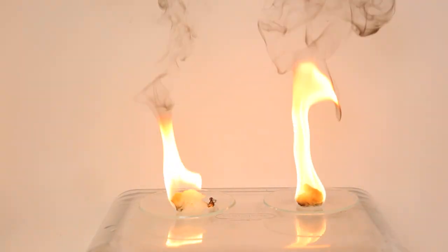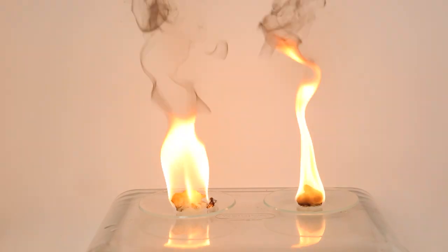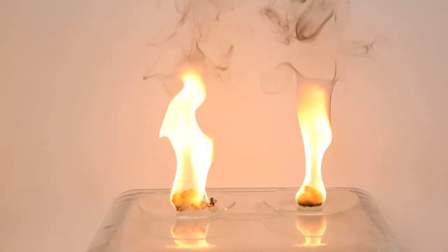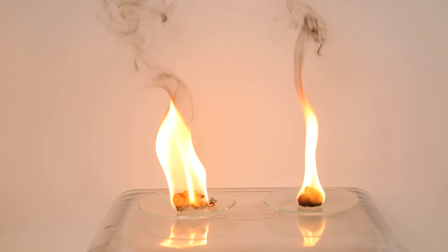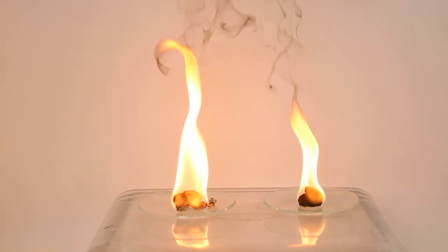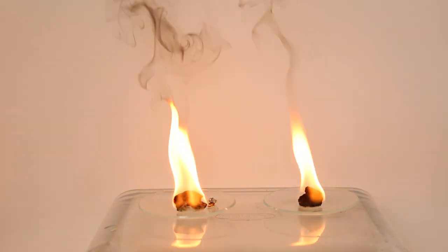I don't see too much of a difference in the flame, so maybe a biodiesel flame is just quite sooty. So that was a way to get biodiesel from sunflower oil. It was relatively simple to do, though the purification could definitely be improved.